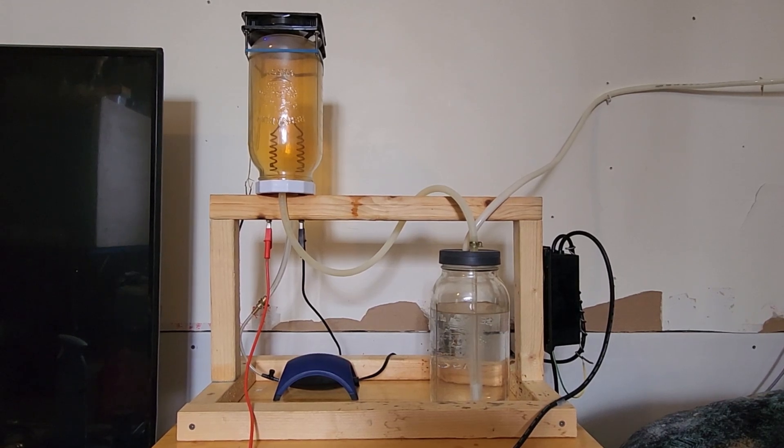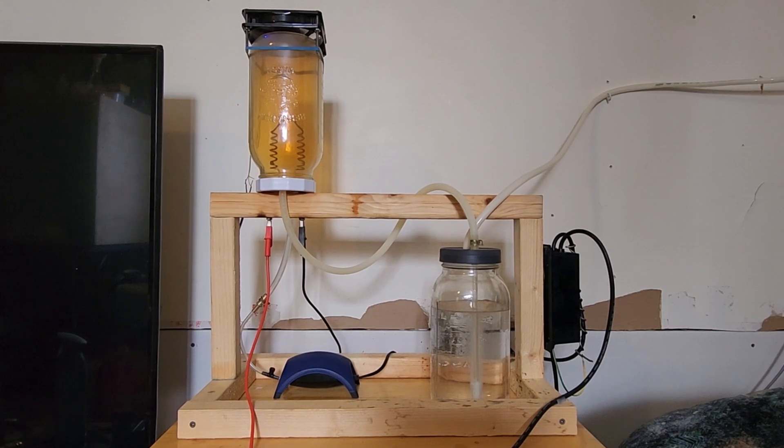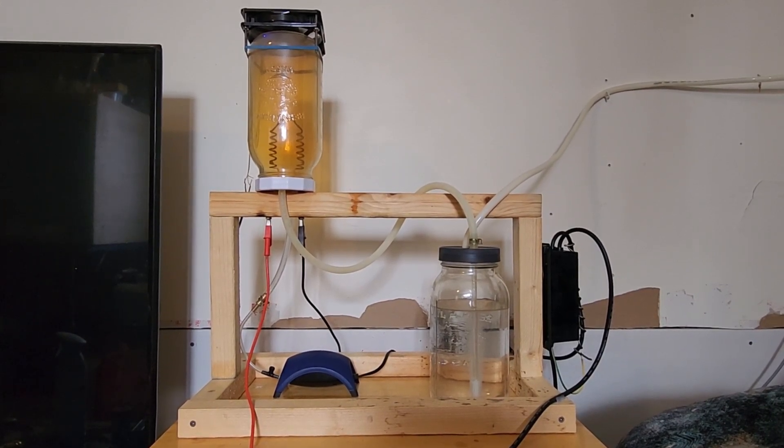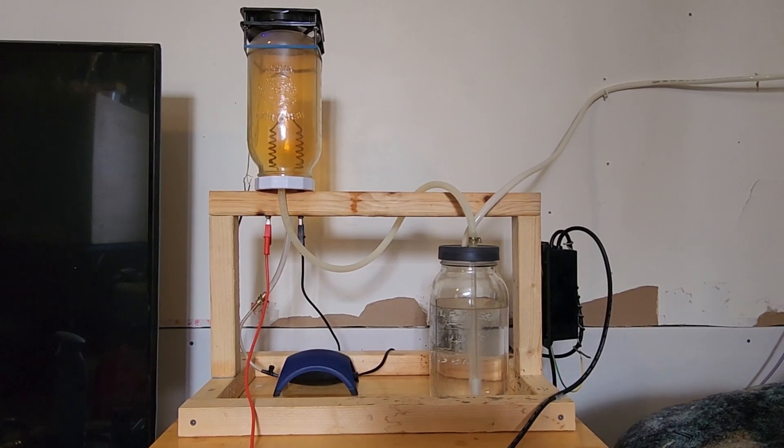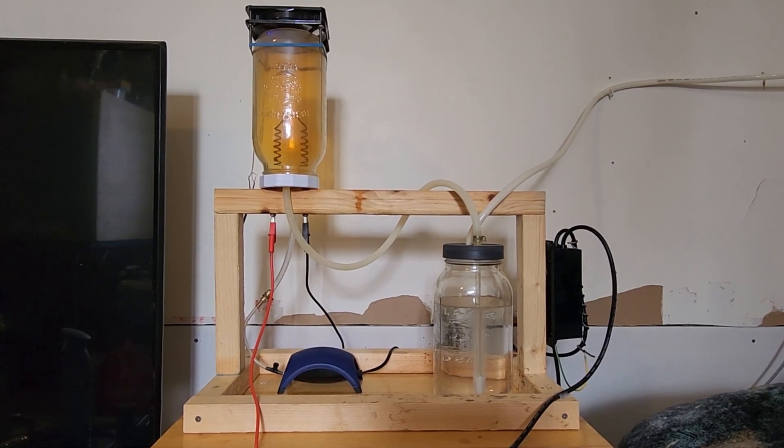Hey YouTube, Copper and Quarter here. Today we will go through the latest modifications for the nitric acid generator. The Jacob's ladder method was very unstable, causing the arc to run for a while and then go out, necessitating constant adjustments of the copper rods. A stable solution was needed and found through the use of a simple arc.